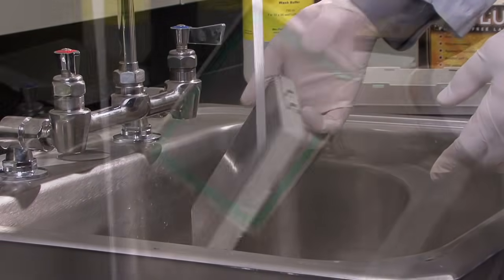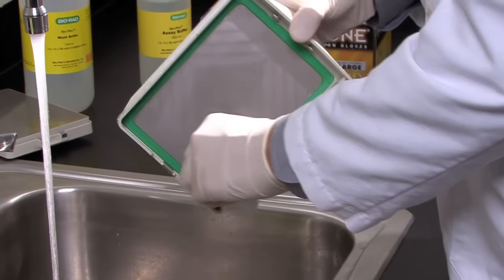Clean up is easy. After each run, the cassette can be rinsed with water and wiped down with a paper towel.